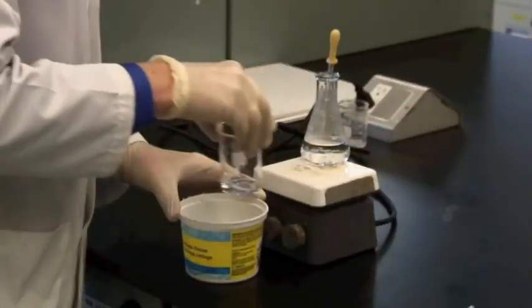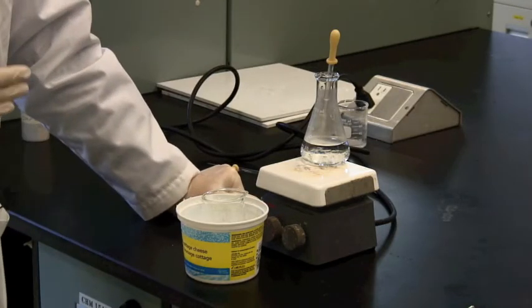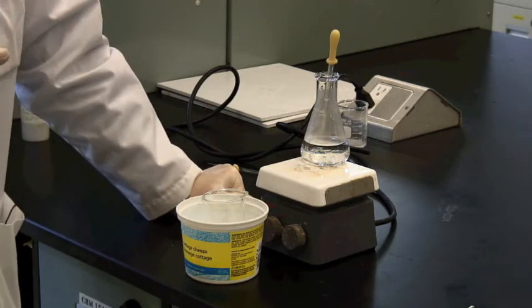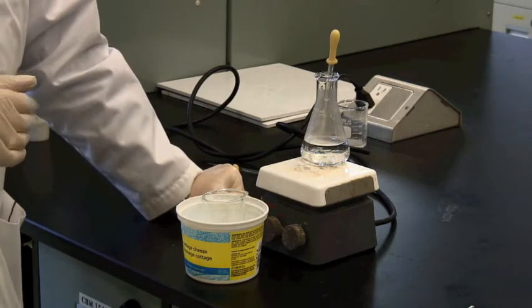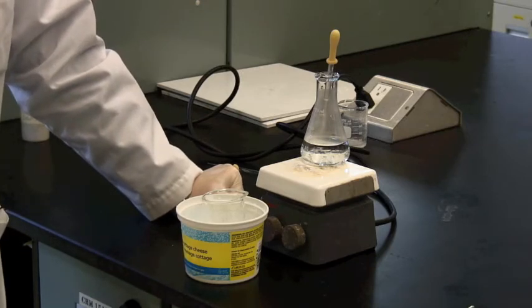And getting some ice into your plastic tub makes an ice bath for you. And once it is cool enough, you can pack that in ice to get as many crystals out as you can. And then once it is chilled, you've got crystals available, filter this off by suction, and you know how to do suction filtration.